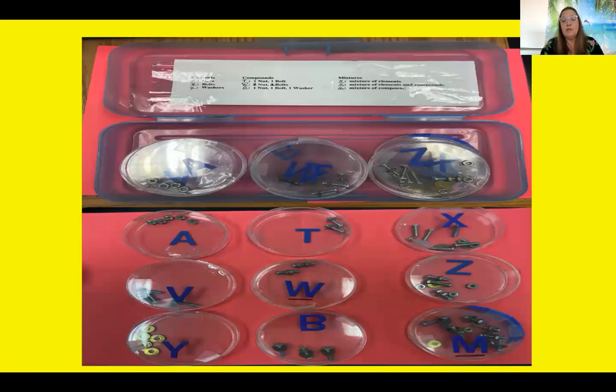And when you finish this is what it looks like. Now you can label them anything you would like. These are the letters that I chose and the top picture is how I store this lab.